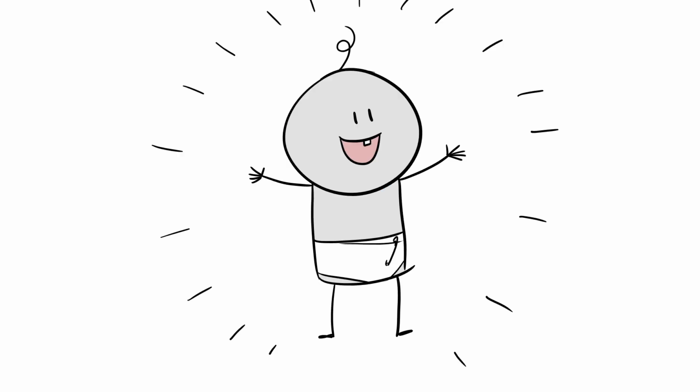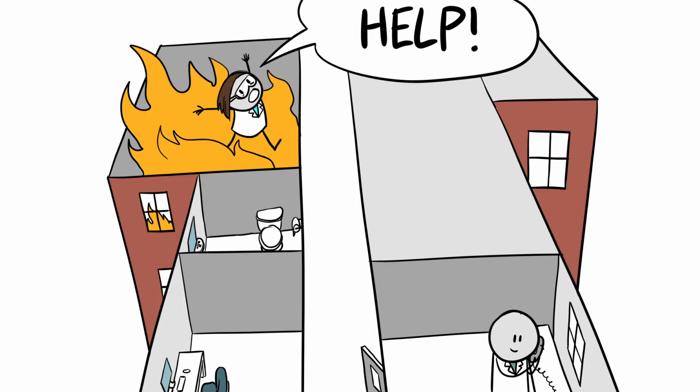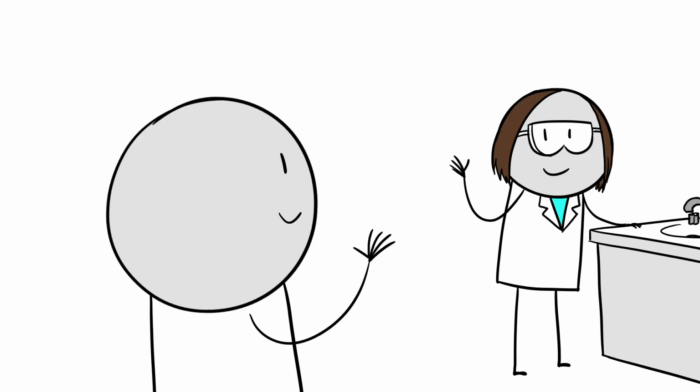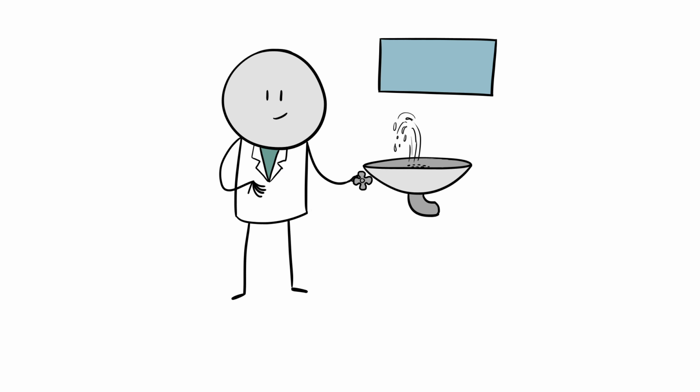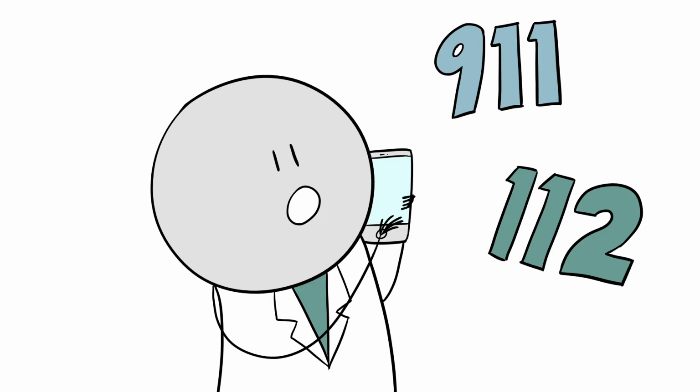It can't be just anyone. It can't be someone down the hall. A responsible partner can see you and hear you, knows how to respond in an emergency, use safety equipment, and be able and willing to call an emergency number.